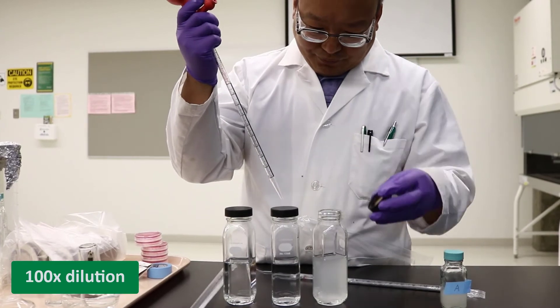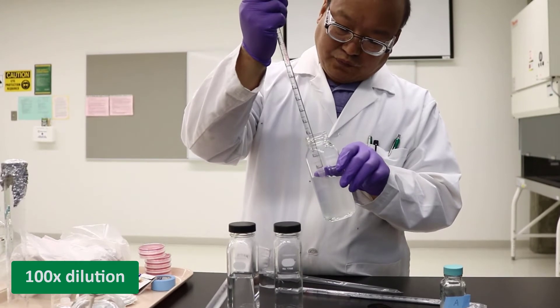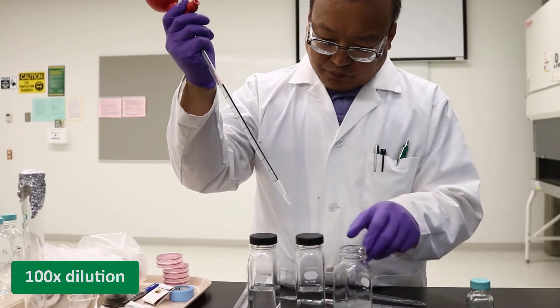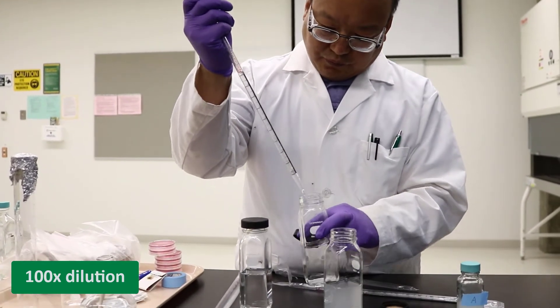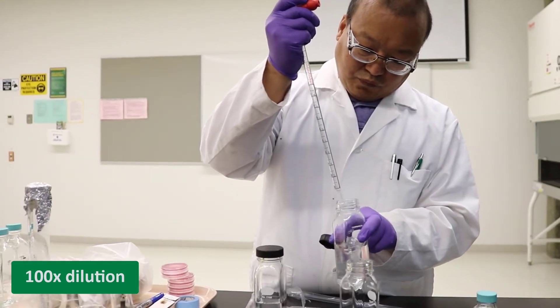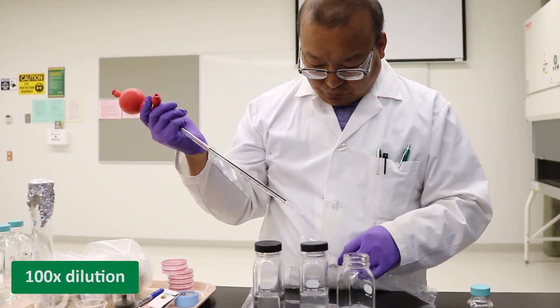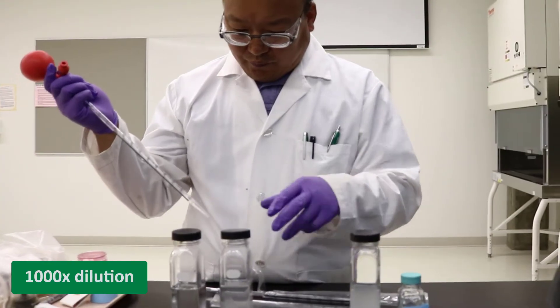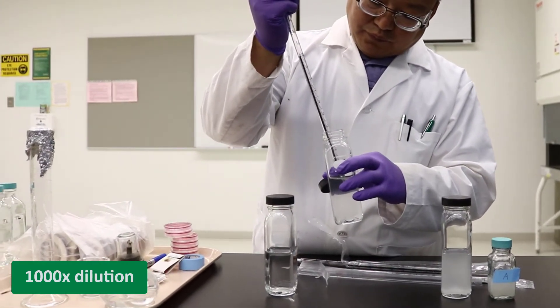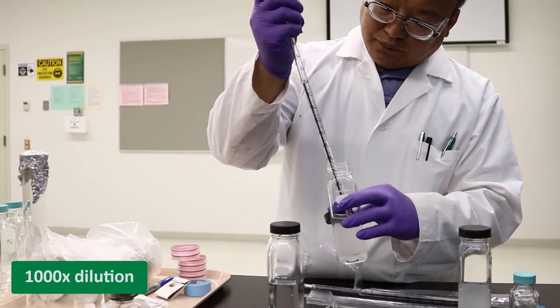Now take a 10 ml sample from the 10x dilution bottle and transfer it to a second bottle with 90 ml dilution solution. This is the 100x dilution solution. Similarly, we can make a 1000x dilution solution, and even more dilutions. In today's work, we only need 3 dilutions up to 1000x.